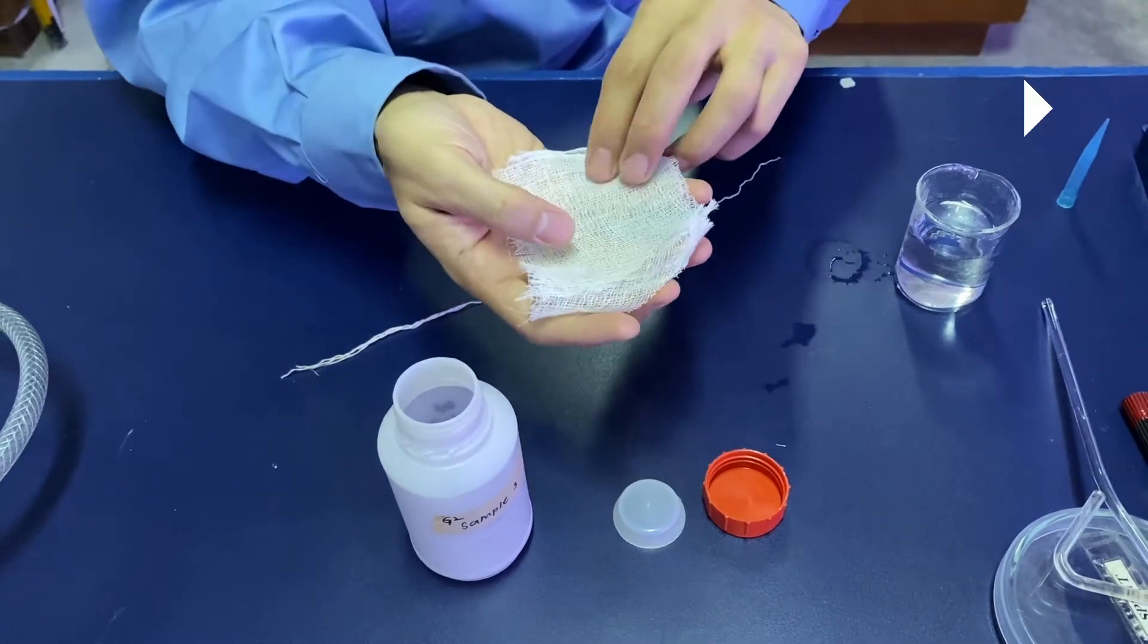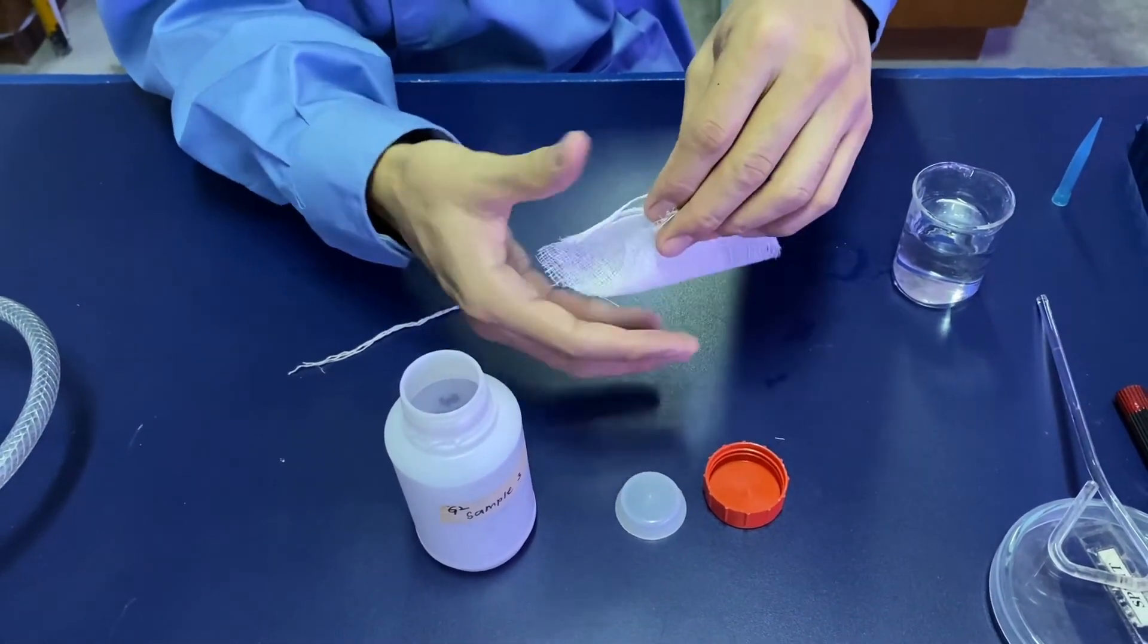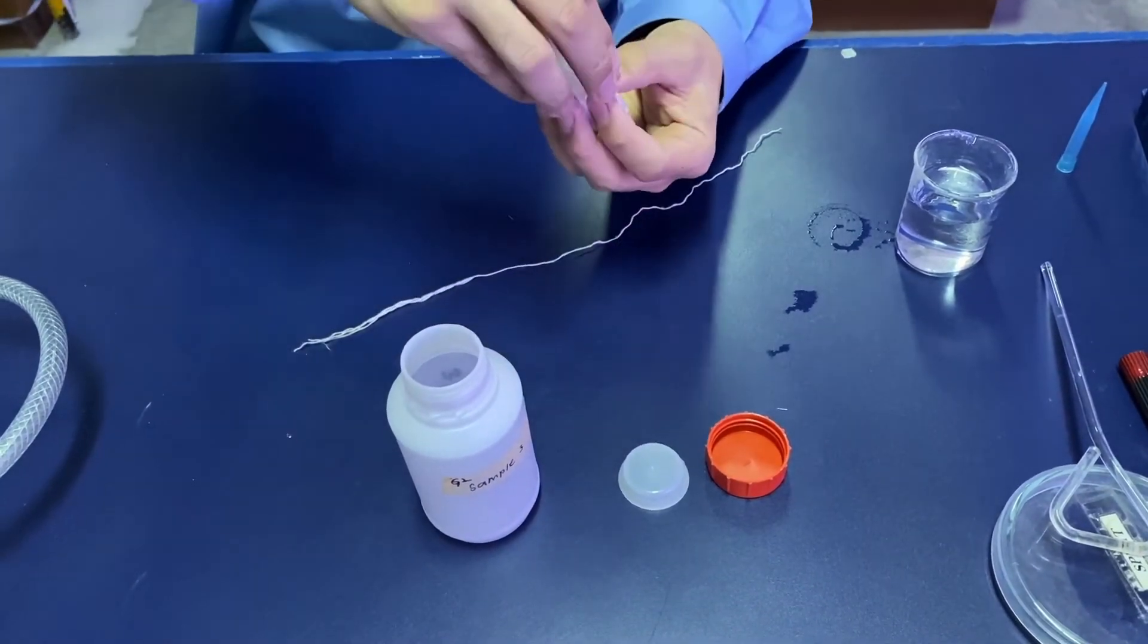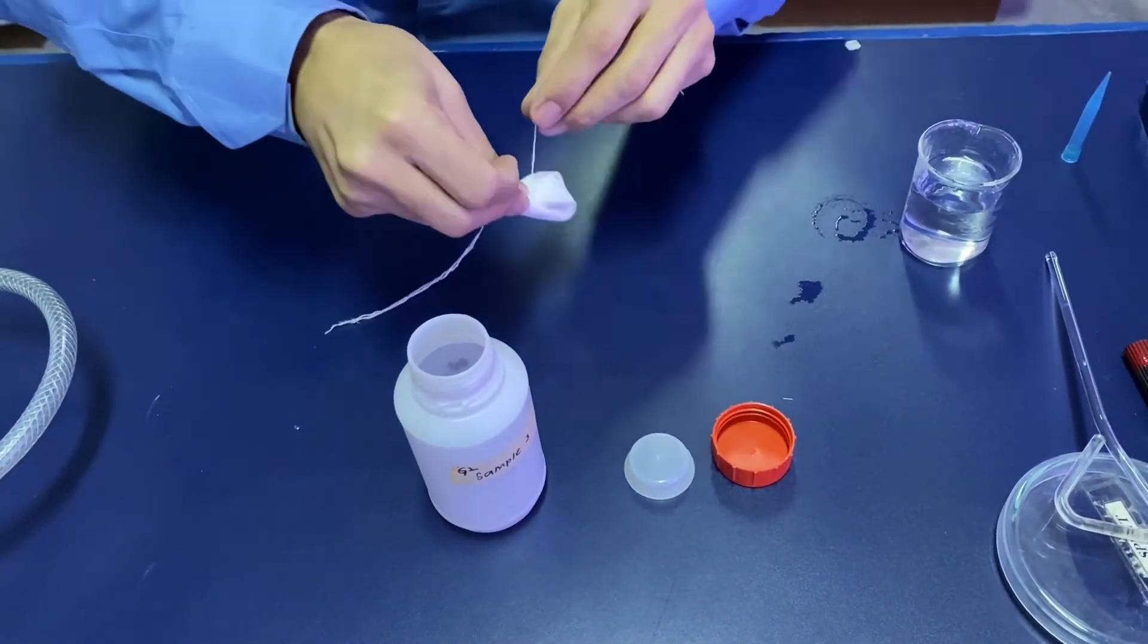Once you have placed the soil on top, you wrap it up carefully and then use a string to secure it.